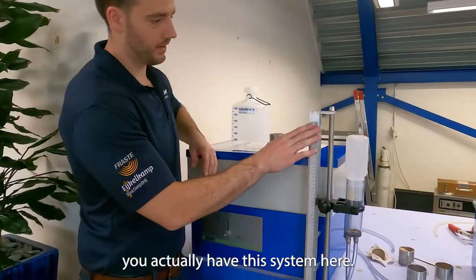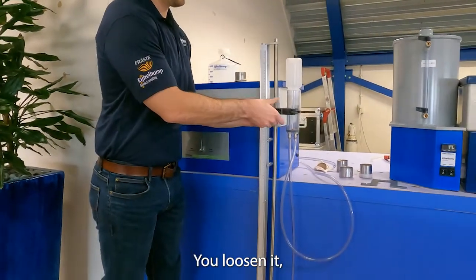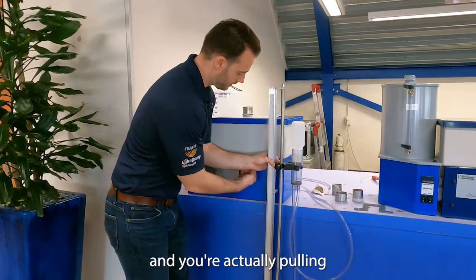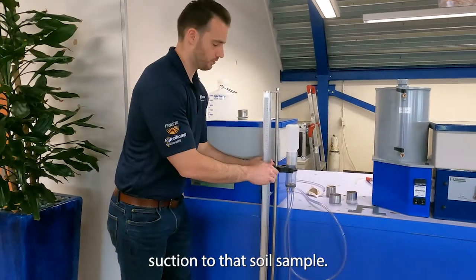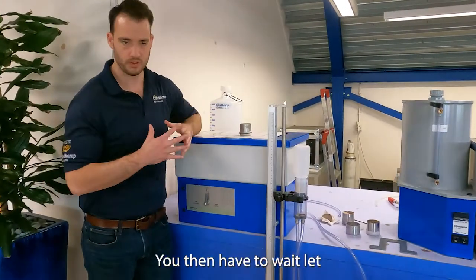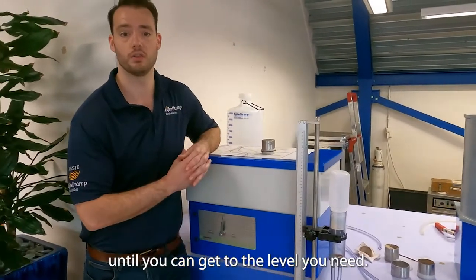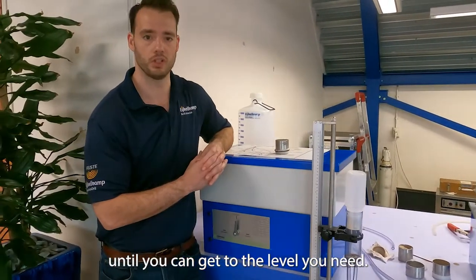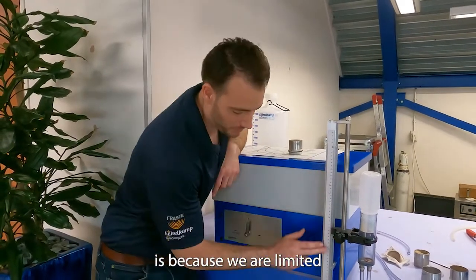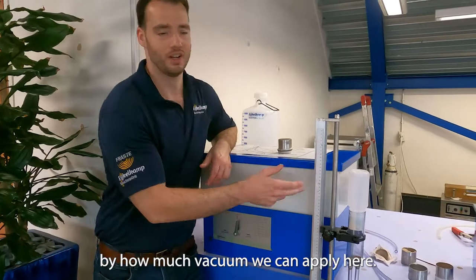To do that, you have this system here. If you loosen it, you pull it down, and you're actually pulling and applying a suction to that soil sample. You then have to let it wait for equilibrium, and you'll adjust it a little bit more until you get to the level you need. The reason it can only go from zero to two is because we're limited by how much vacuum we can apply here.